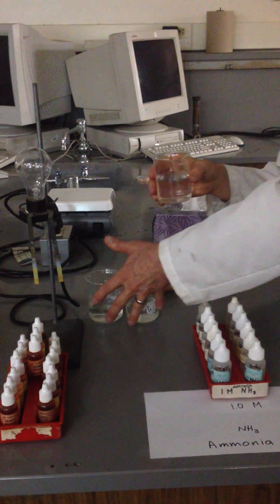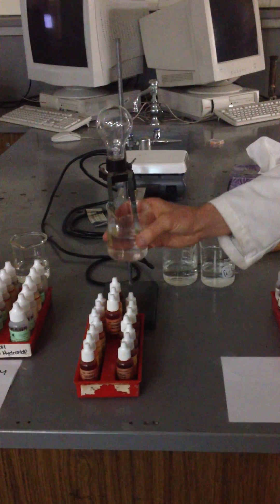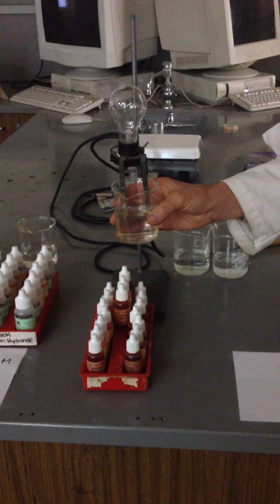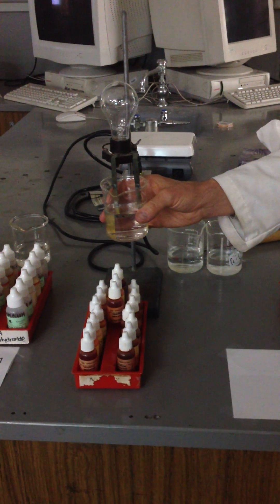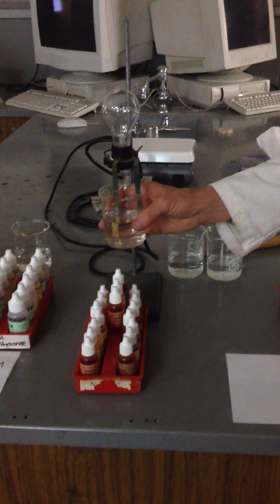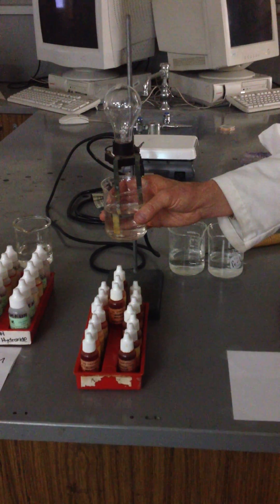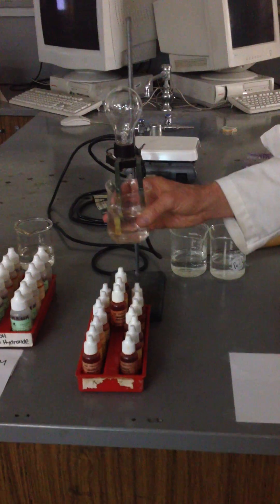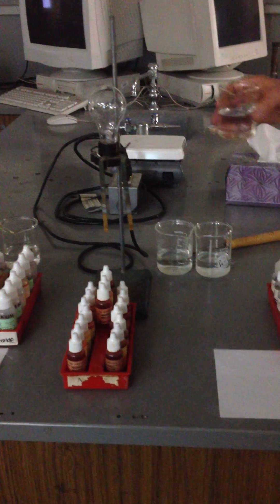First off, here we are with deionized water. Nothing. Water does not conduct electricity. What does it need? Ions. No ions, no conduction.